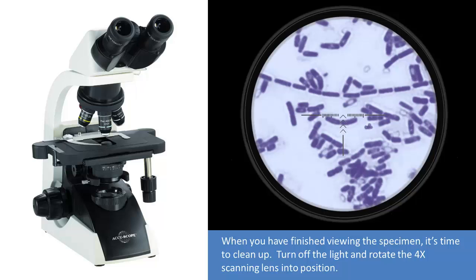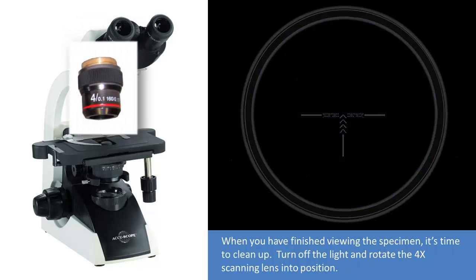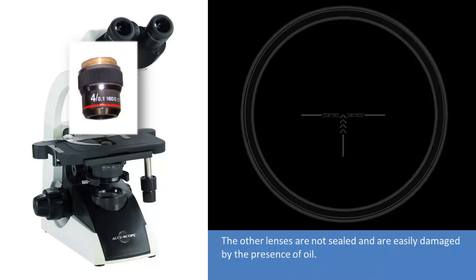When you have finished viewing the specimen, it's time to clean up. Turn off the light and rotate the 4x scanning lens into position. Be very careful not to allow any of the other objectives to contact the oil. The oil immersion lens is specially sealed to prevent oil from entering it. The other lenses are not sealed and are easily damaged by the presence of oil.